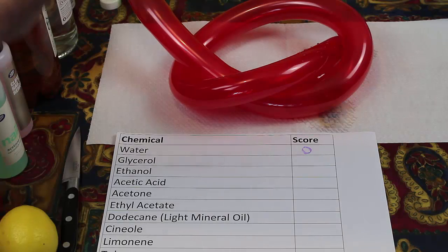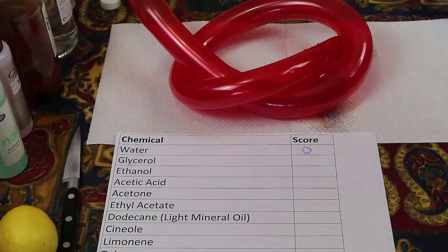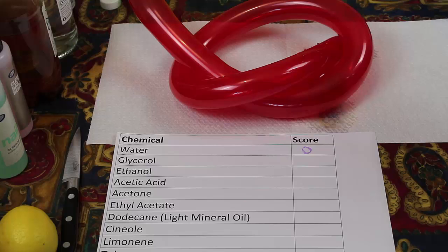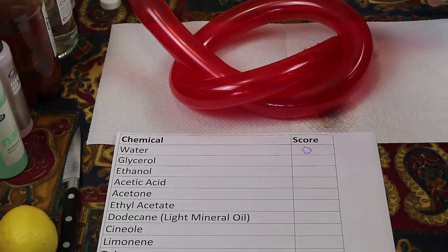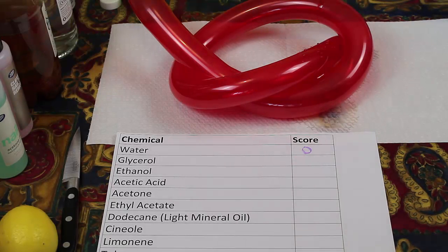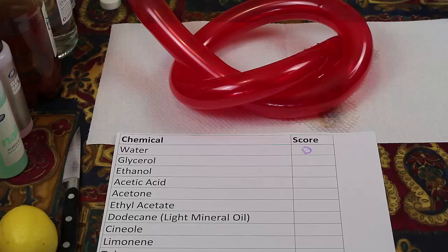What about dodecane? Well I don't have dodecane but I have some lamp oil. That has a safety top which was defeating me. Now I put some lamp oil on. And that seems to do nothing at all.